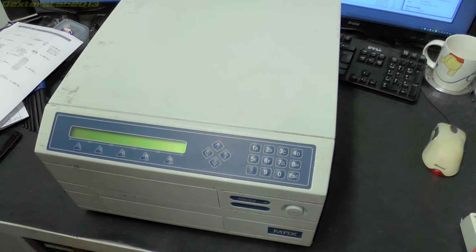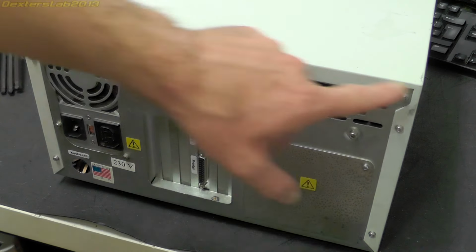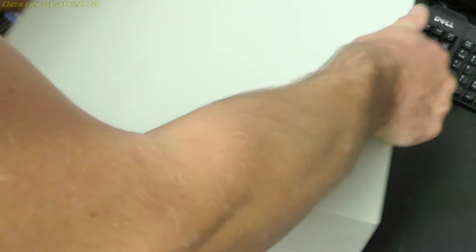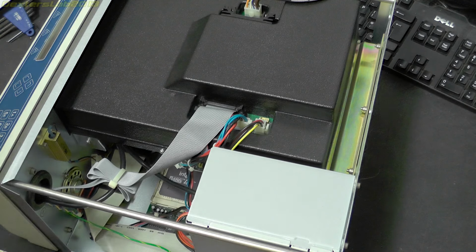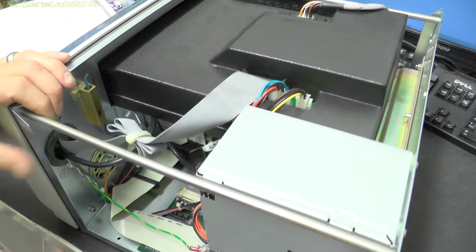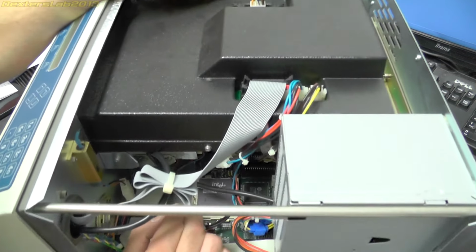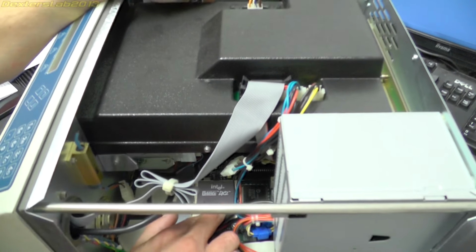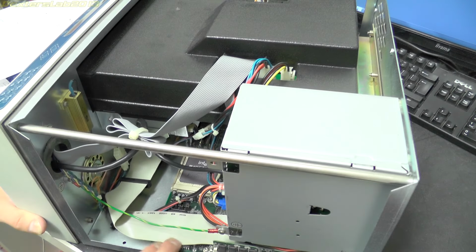So I'll just whiz this around and we'll take the top off. So the top just comes off with a few Allen keys that are on here, so let's just take these out. Right, that's all the screws removed, so we'll just, yeah, so we just got a standard, if this was in a slightly different shape, it would be pretty much like an old PC case. And yes, looking at this, it does appear as though we have a PC motherboard in here. Just down here, in there, you can probably just start to make out an old, what have we got, an Intel 486DX2, and on a standard PC motherboard.